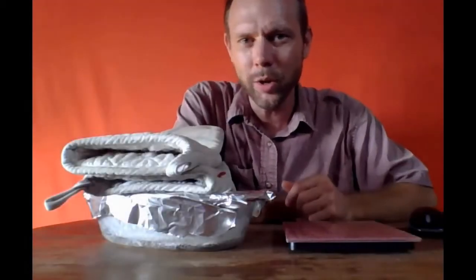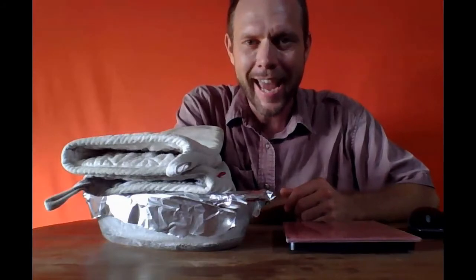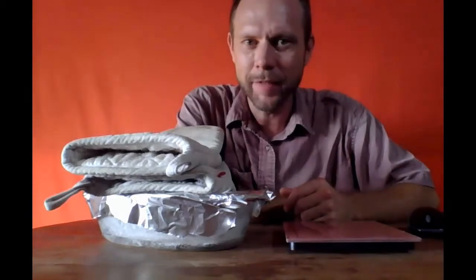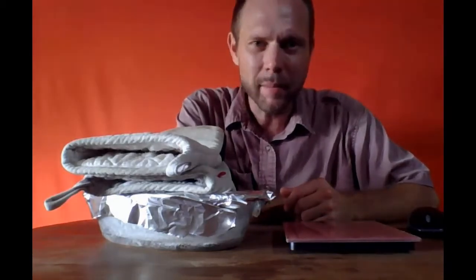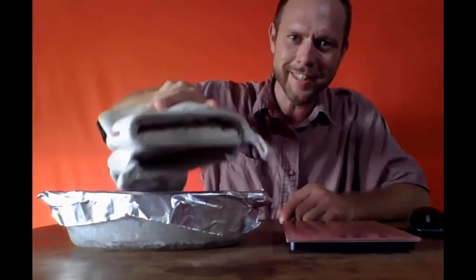Okay, so the salt has presumably crystallized. I have taken it out of the oven after a little more than an hour and a half of heating at medium temperature. You saw it boiling away. You can still maybe see that evidence of the white salt crystals.